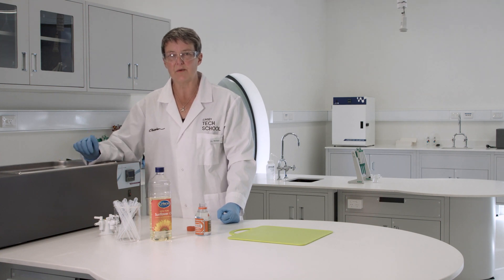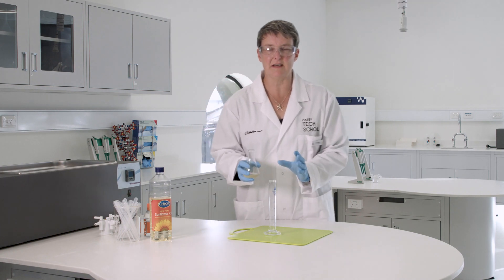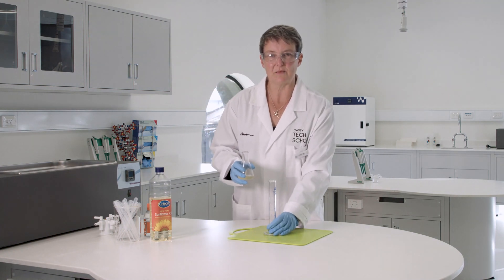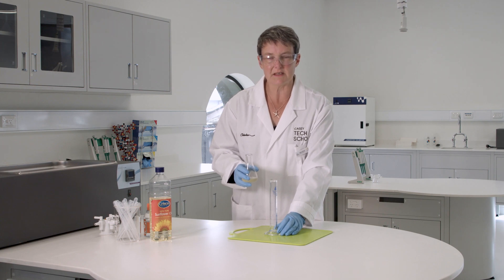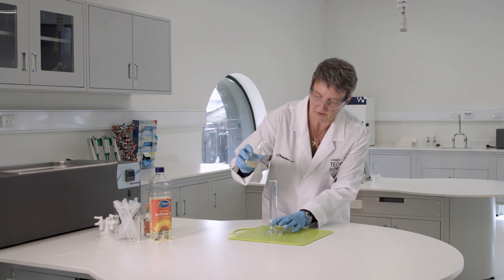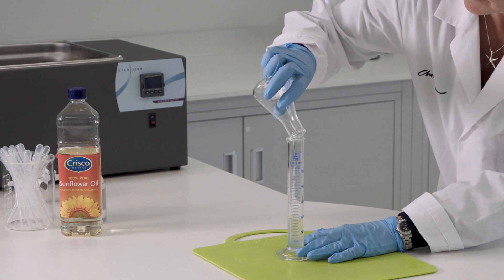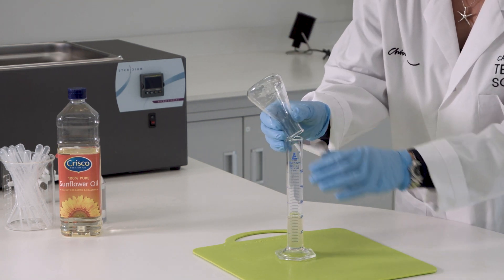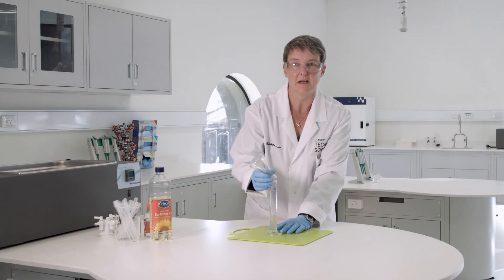I'm going to leave that in there for 10 minutes and then pour it into another container. It's been about 10 minutes at 65 degrees — it's ready to start separating out. To do that we need it to settle, and we're going to take a shortcut: pour it all into a measuring cylinder. When it separates into different layers, we'll be able to read off the exact volumes of those layers straight away. You might want to use a clamp to hold it up to make sure you drain all of it out. Then we're going to leave it sit for about 15 minutes and come back to look at the two layers.